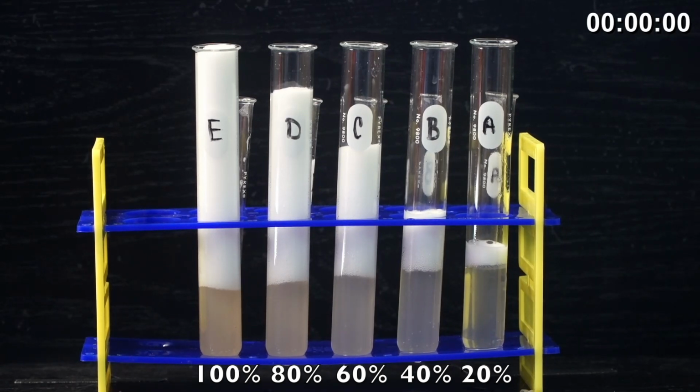All right, the 4 minutes is now up. So in quick succession, go ahead and look at the ruler and measure from the bottom of the oxygen gas white foam to the top. Remember not to measure from the bottom. We're not measuring from the bottom of the test tube, but from the bottom of just the foam. We're just measuring how much oxygen gas was created as product.